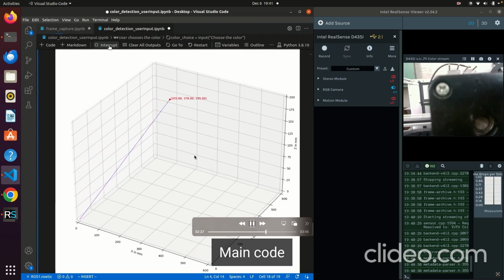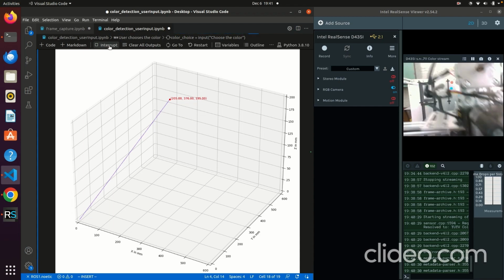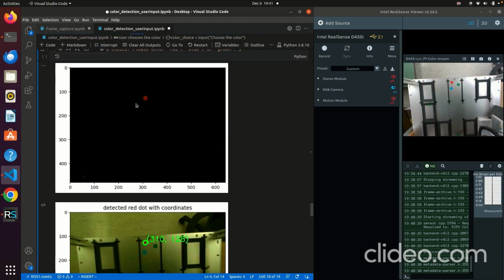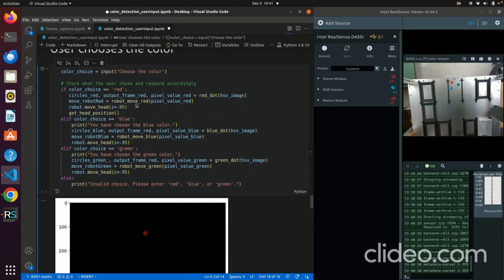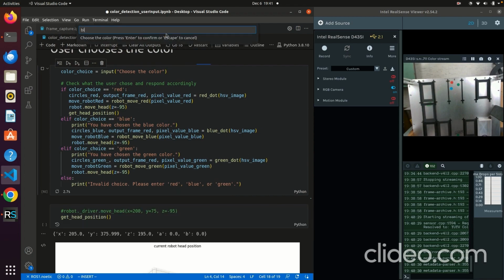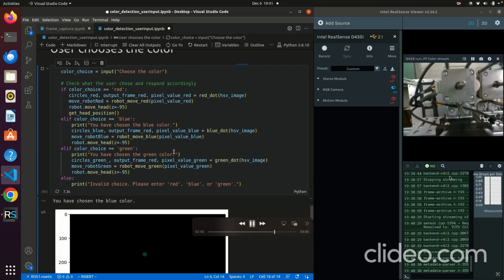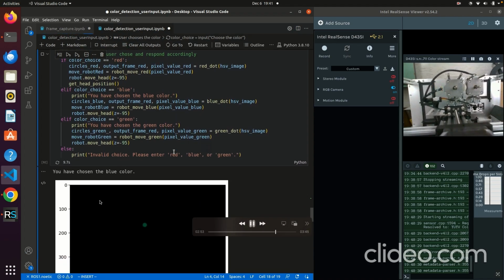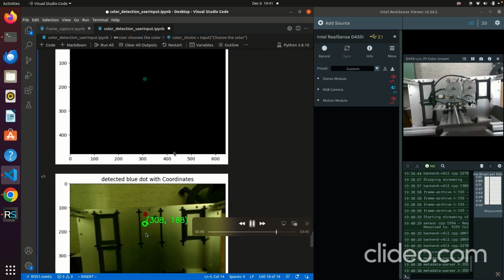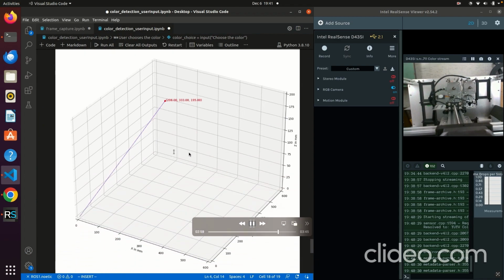Now again, we run the whole code, we home the robot, we reset it. Then we're going to do the same for blue and green. Now it's prompted, so set blue, and same idea, you will see the blue mask. You have chosen the blue color, it goes to the blue mask, where blue is in the pixel system. This is the data, X, Y, and Z, and this is where the head moved.